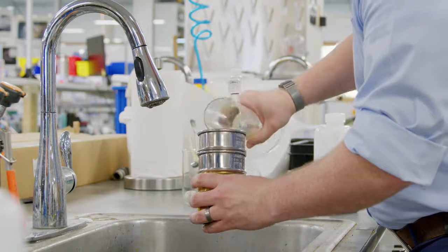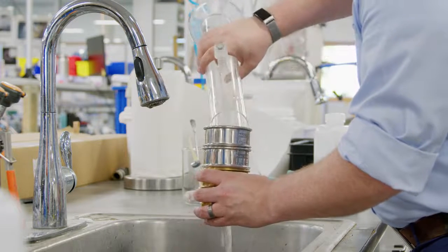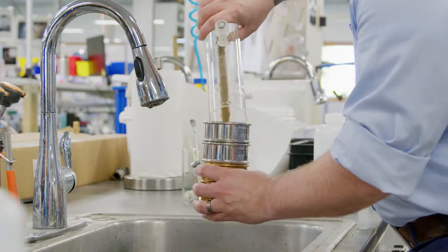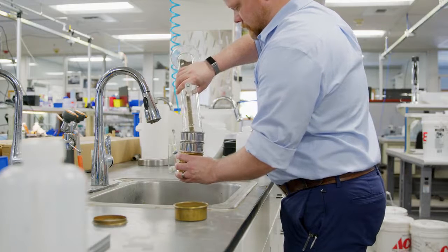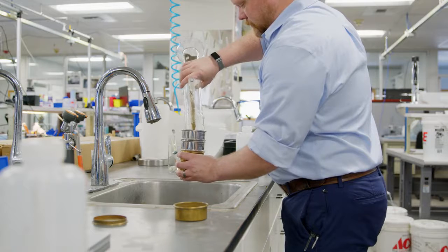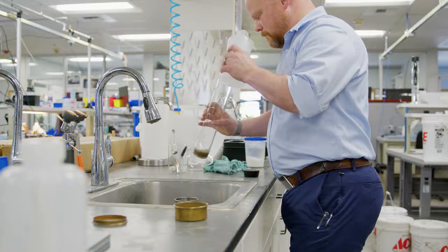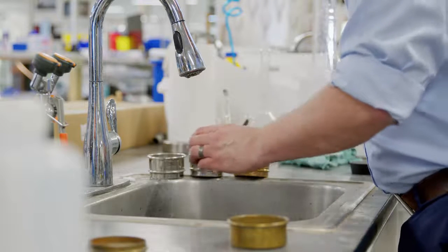The sieves are mounted downward with the largest mesh opening on top. Depending on the screening machine, the duration and type of movement will have to be defined. Please refer to the appropriate screening machine manual. To sieve the PARIO measurement sample, transfer the contents of the PARIO sedimentation cylinder into the uppermost mesh of the screening tower. Use a spray bottle to transfer all particles of the soil sample into the sieve. Continue the screening until the water coming out of the drain hose is clear.